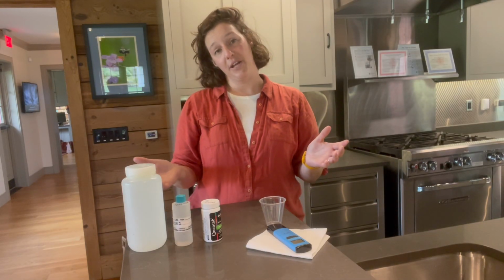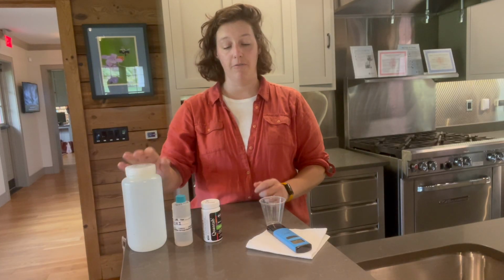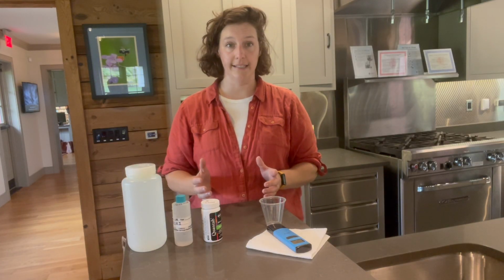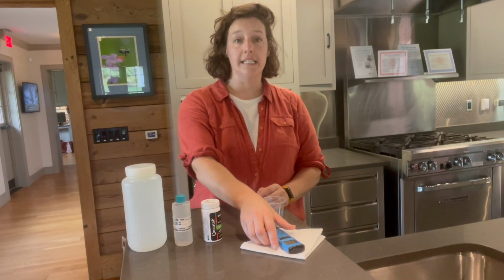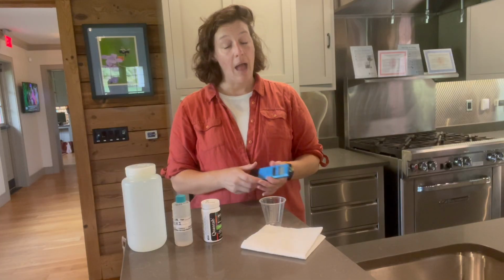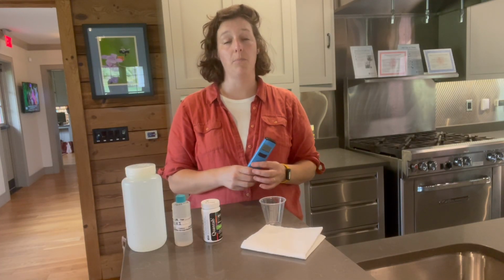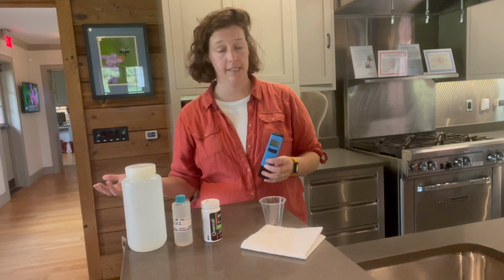Today we're going to be going over how to process a grab sample from a stream for conductivity and chlorides. So conductivity is a non-specific measure of contamination in a stream. And when I say non-specific, I mean conductivity levels can increase in the presence of a number of different pollutants.